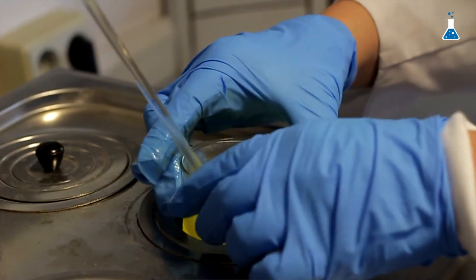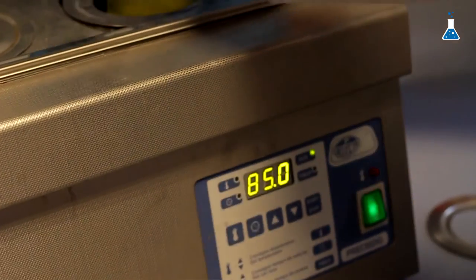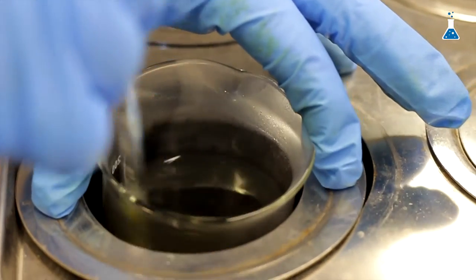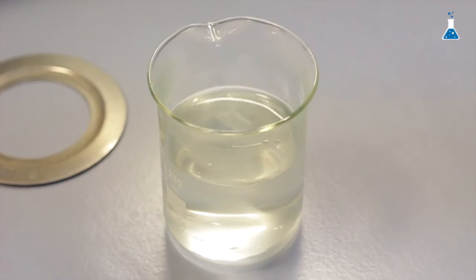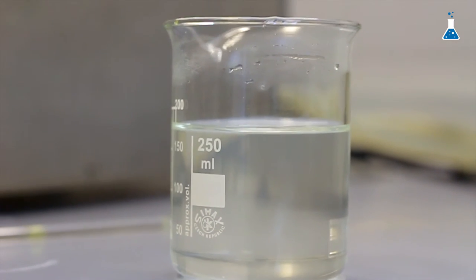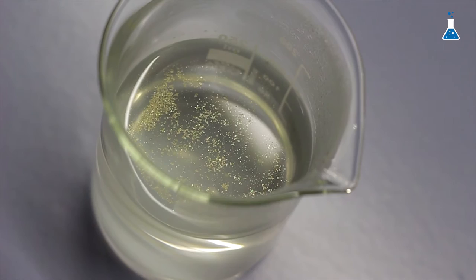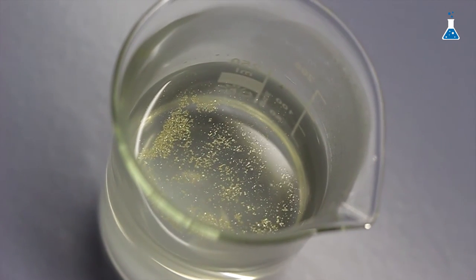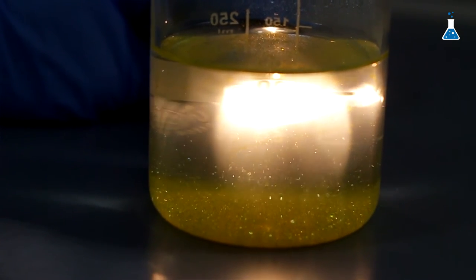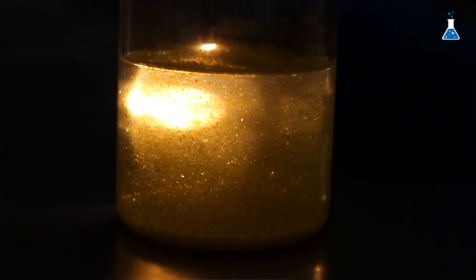Let's now pour all the remaining lead nitrate solution very fast over the potassium iodide solution. In order to appreciate the beauty of these yellow crystals, we are going to heat the mixture in a bath at a temperature of about 80 degrees Celsius until it is completely dissolved. When the solid has been dissolved, it produces a colorless solution again. And now we are going to let it cool down.